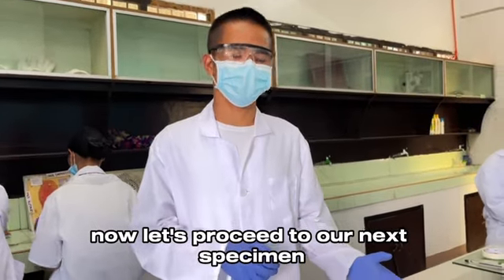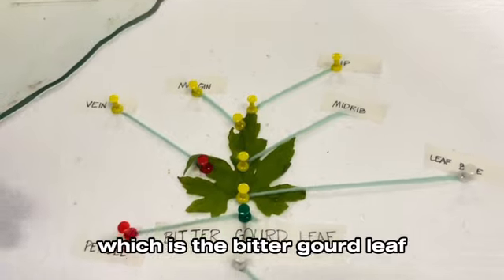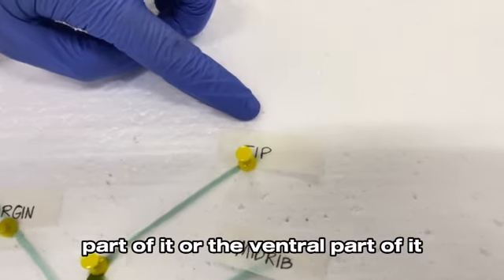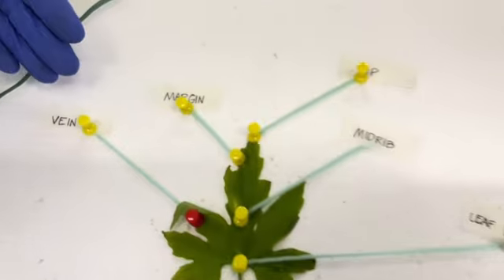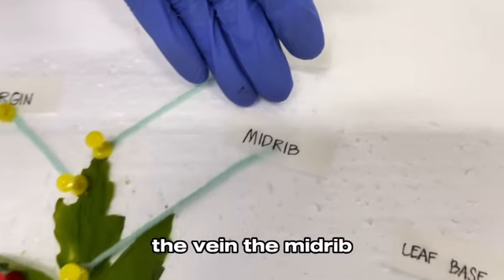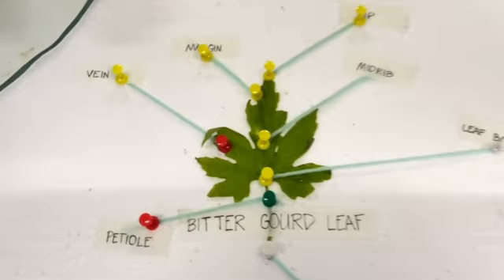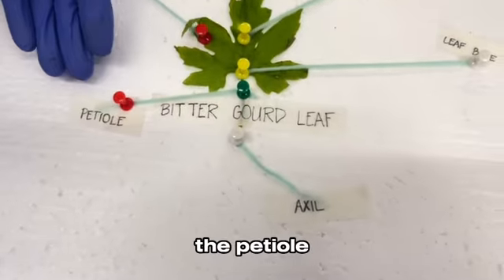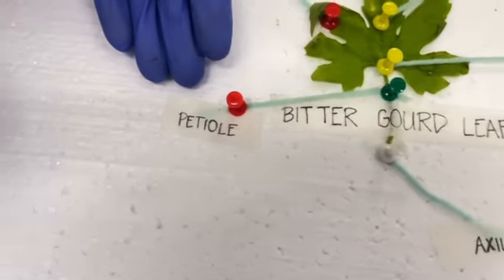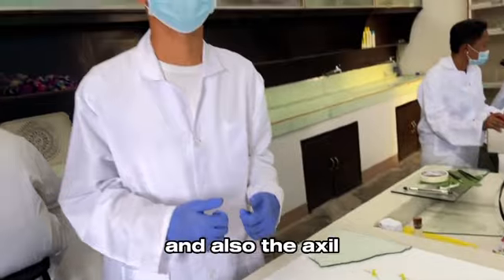Now, let's proceed to our next specimen, which is the bitter gourd leaf. The ventral part of it has the tip, the margin, the vein, the midrib, the vein, the leaf base, the petiole, and also the axil.